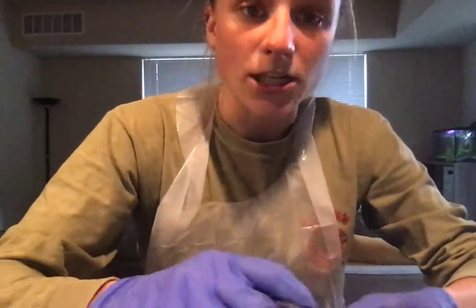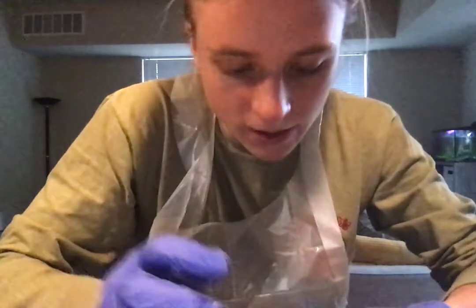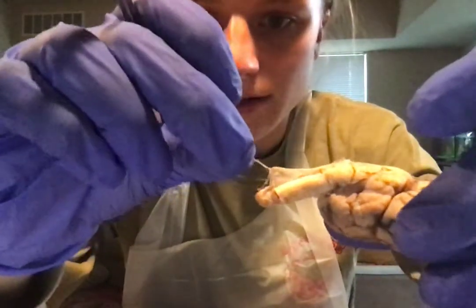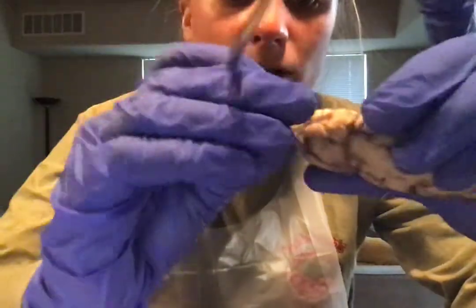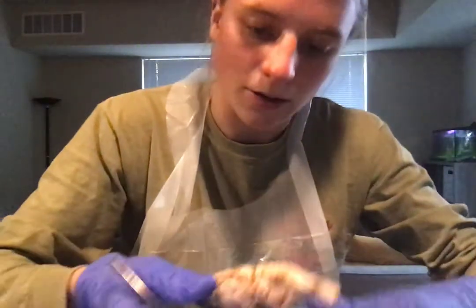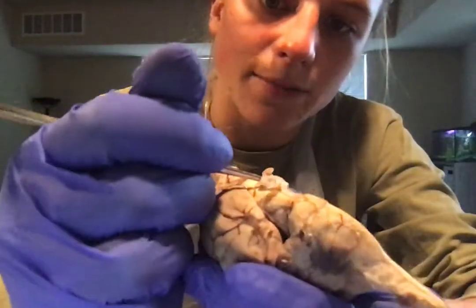Next, we have the meninges. So the meninges protect and cover the brain or the brainstem and the spinal cord. So you can see there are meninges. It's kind of that fibrous material. It's thin, almost looks like tissue paper, but it covers the spinal cord here. And then we also have the brainstem meninges. I think it's a little clear. Yep. So they're a little more clear on this one, but we've got our brainstem meninges right here.